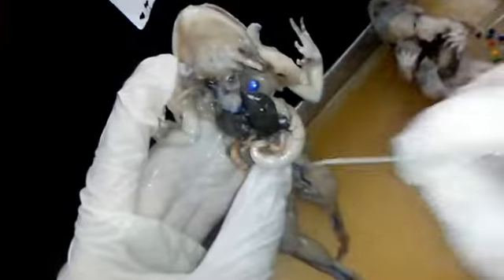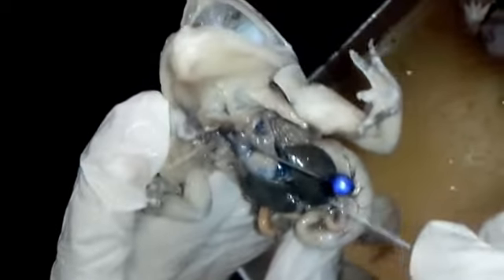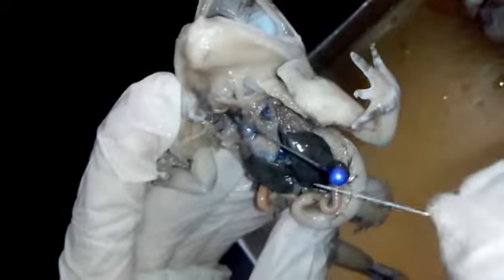This is the heart, which pumps the blood to all parts of the body. And these are the liver, the largest part of the digestive system.